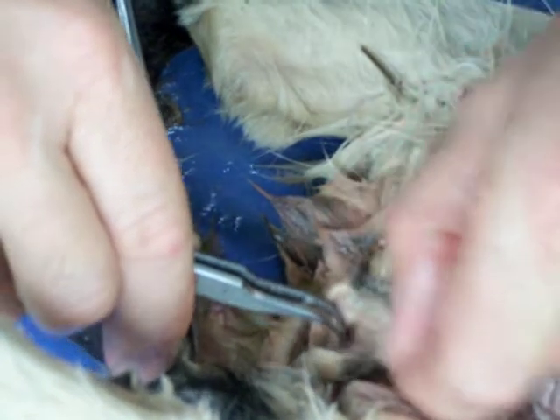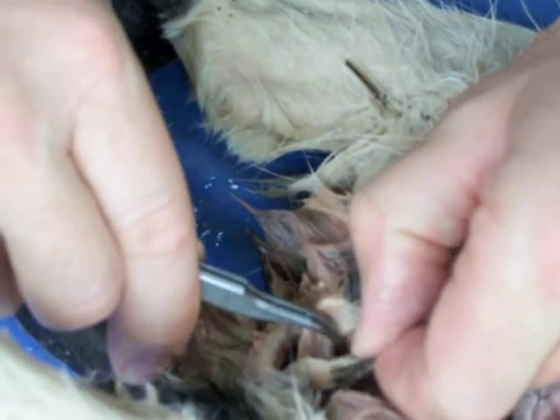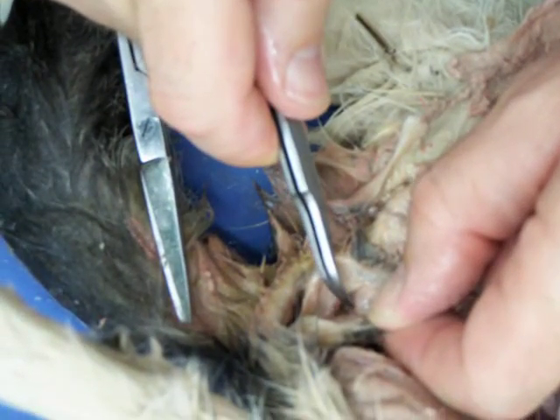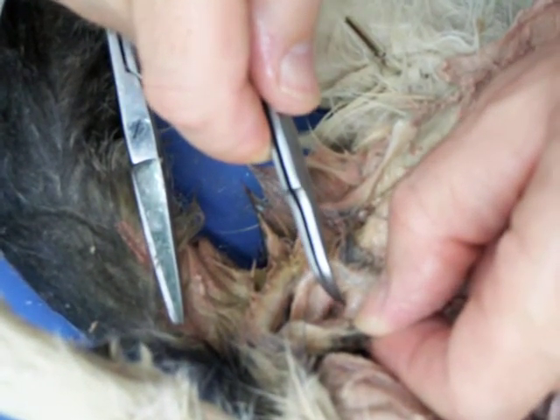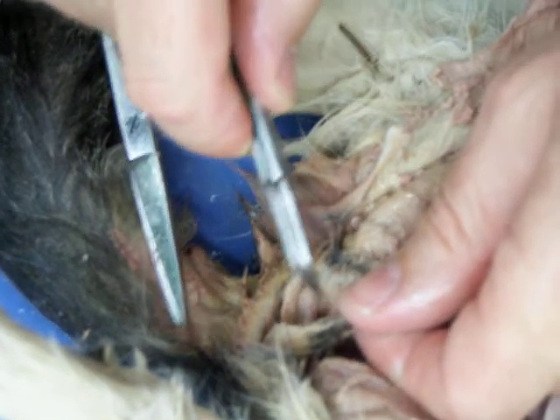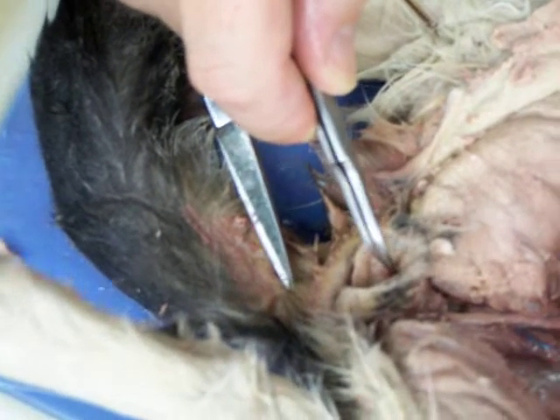And the urethral orifice, I'm trying to see if I can see it from here. The urethral orifice will open up into this wall just ventral to the vaginal opening. And so this is a common area for both the excretory and reproductive tracts, and so that's the vaginal vestibule.